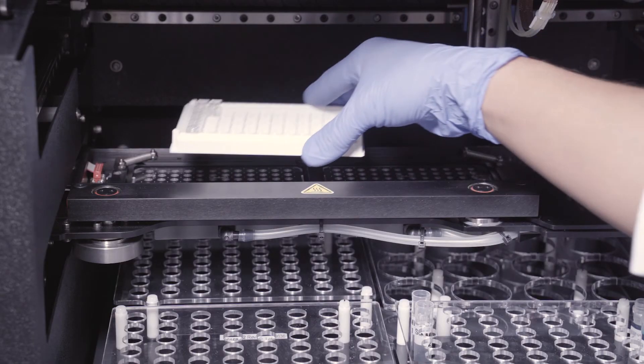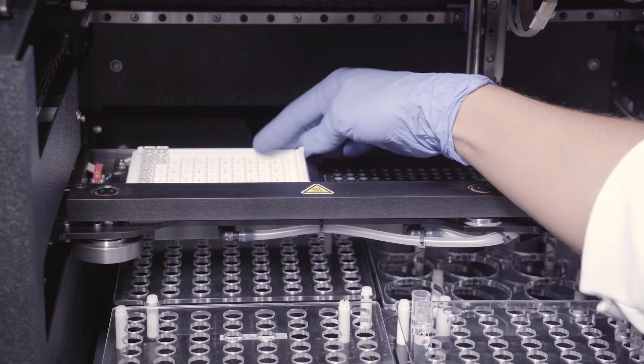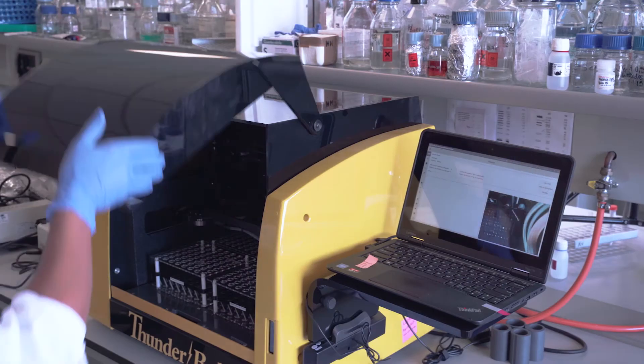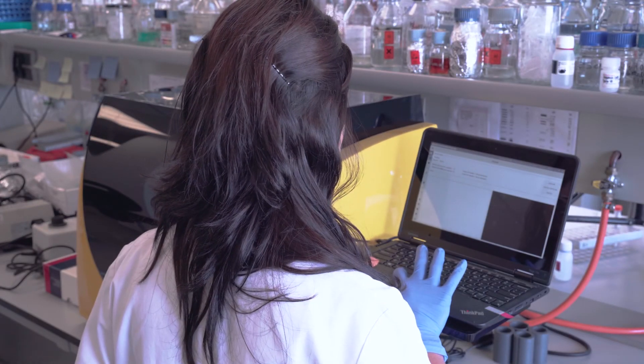Place the plate with the necessary wells and check that everything is correct. Press start button and let the machine perform the assay.